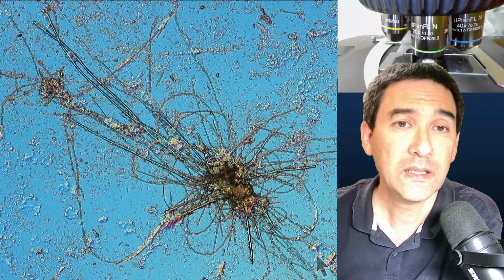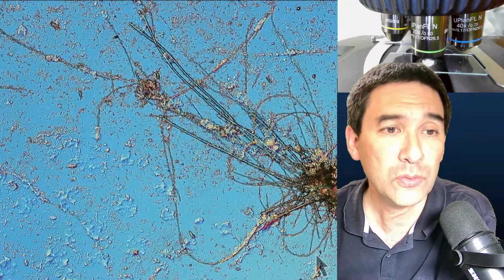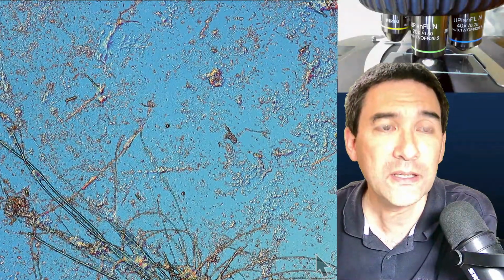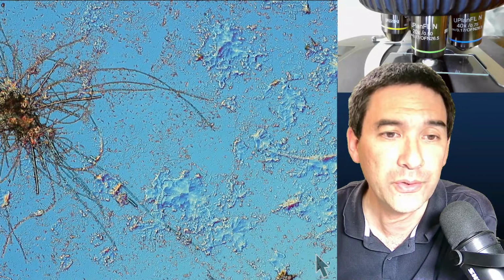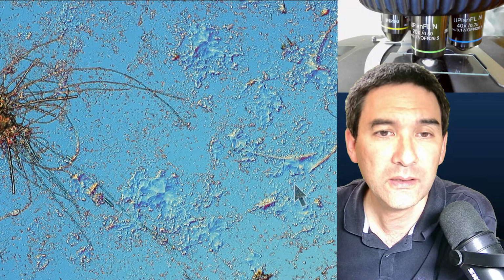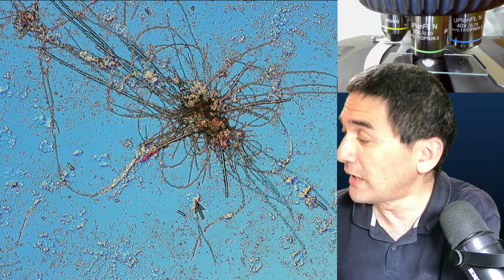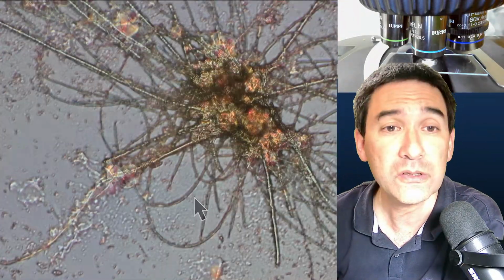Yeah. And what you see is because water also contains some minerals and salts. You can also see that all of those little dots that you see here are basically calcium carbonate deposits and salt deposits and so on. It almost looks a little bit crystalline over here, like crystals forming. Okay, so this is basically without mounting medium. And what I would like to try now, let's go up with the magnification, right? And let's see how this looks.